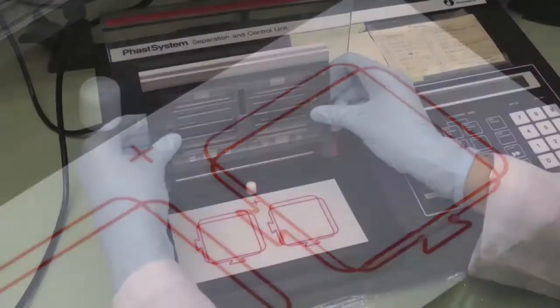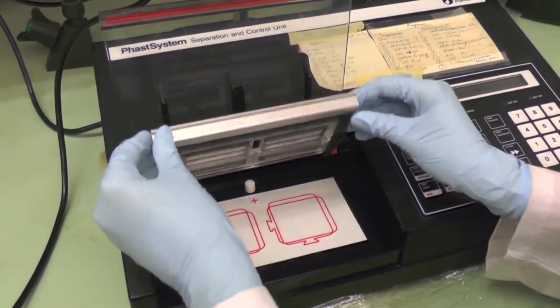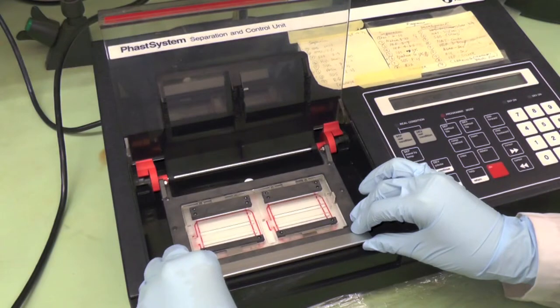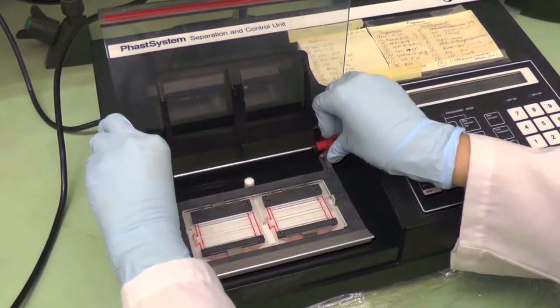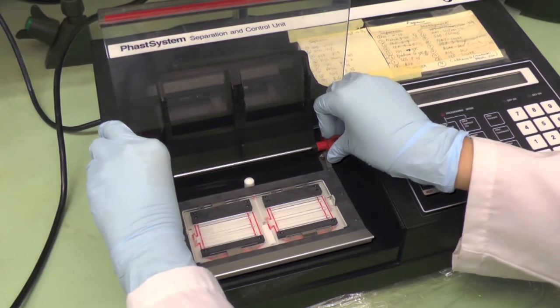Keep the cover for later use. Lower the electrode and if the electrode does not lie flat on the gel surface, then move the red knob downwards. The higher position is for SDS page.